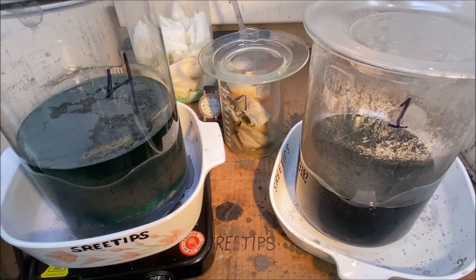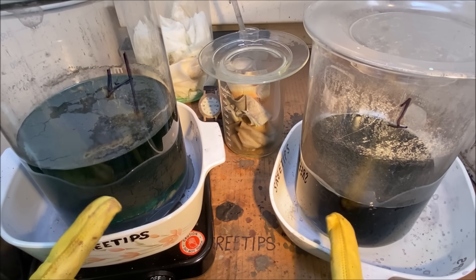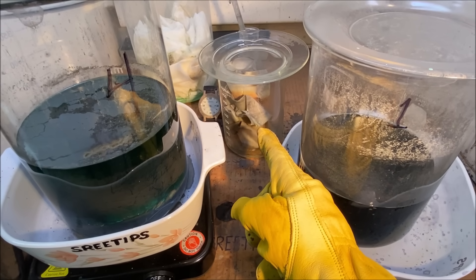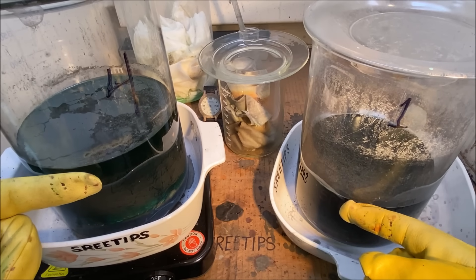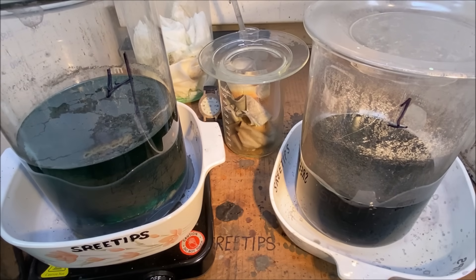Welcome back to part 5 of the Anode Filters Recovery and Refining Series. I've got this fourth extraction done. It's the fourth extraction done here. I've got our palladium salts in these filters back here. So now the next step is to get this liquid out of these beakers and through a filter so we can do a fourth palladium extraction.